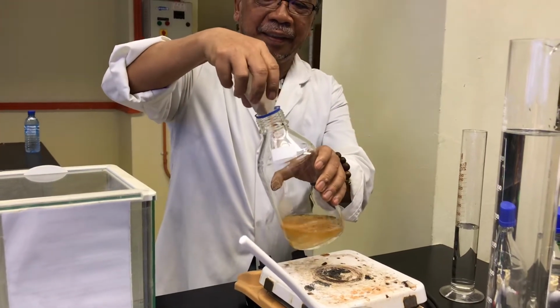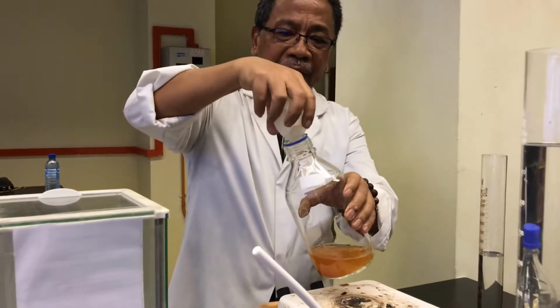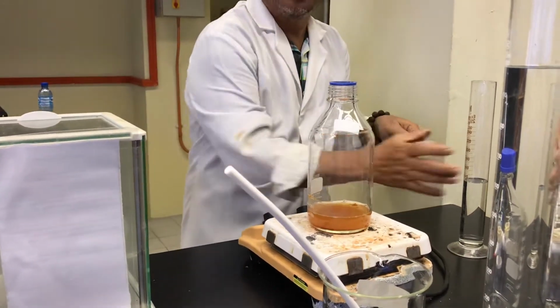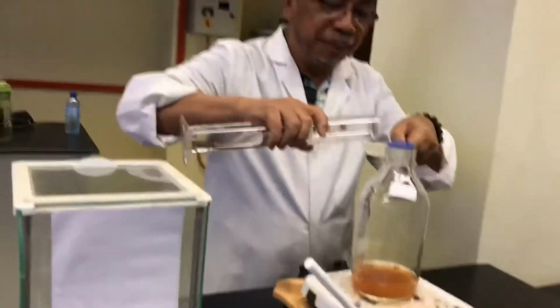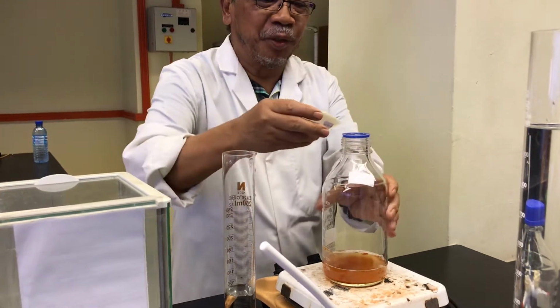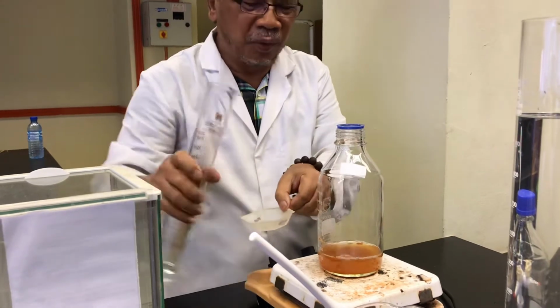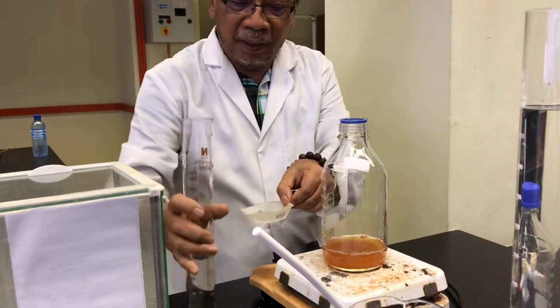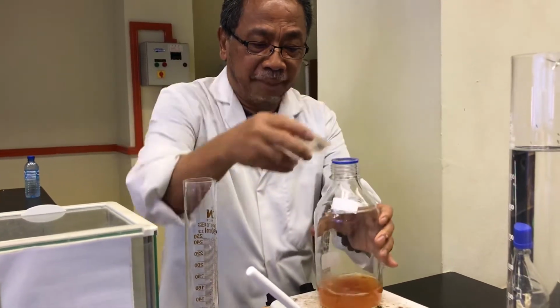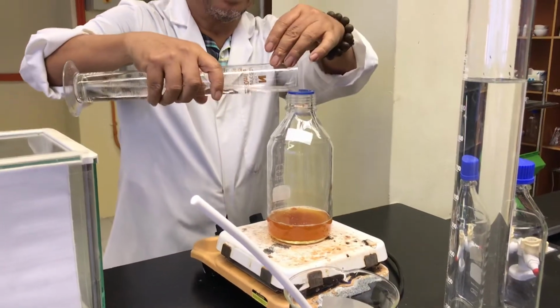No, you just do like that. What happens is if you put all the 250 together there, you don't have water to rinse. You have to rinse your small plate, or I don't know what you call it. So you have to rinse them there, and at least twice, because sometimes the media sticks to it, and when you are okay with that, put it aside, and then you pour everything.